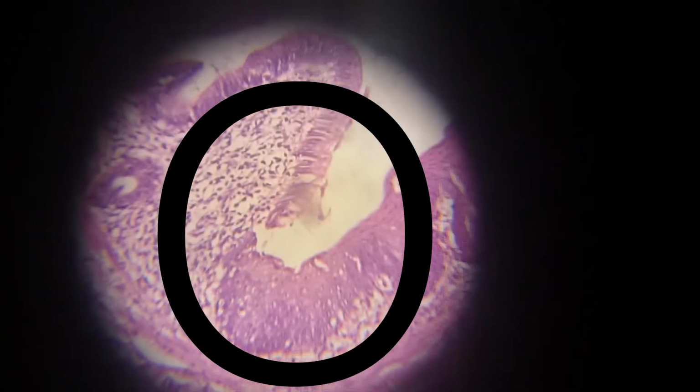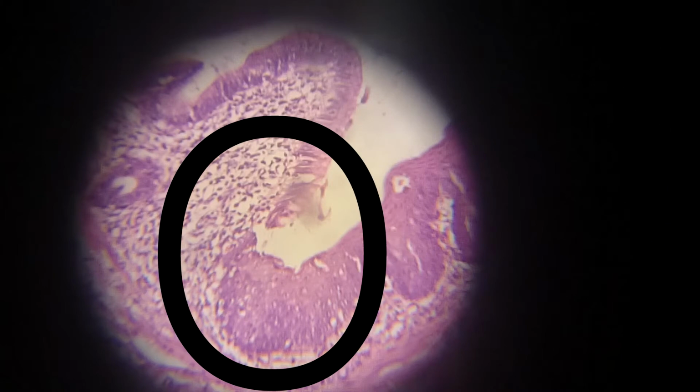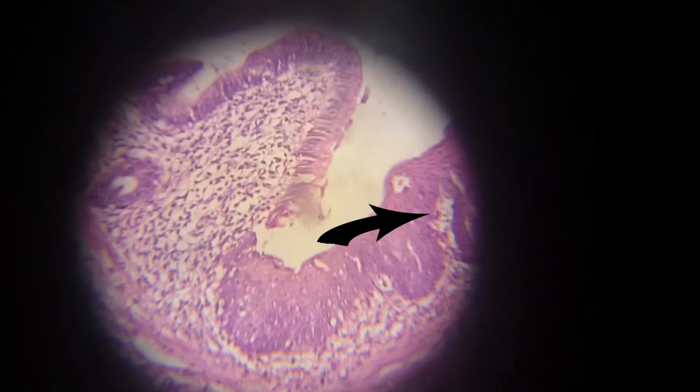The only way to identify the presence of the esophagus is to notice this junction. This junction means that there is a point of transition between the gastric epithelium and the esophageal epithelium. The esophageal epithelium is formed of stratified squamous epithelium, while the gastric epithelium is formed of columnar epithelium. This junction is the only thing through which we may diagnose that this is the junction slide.